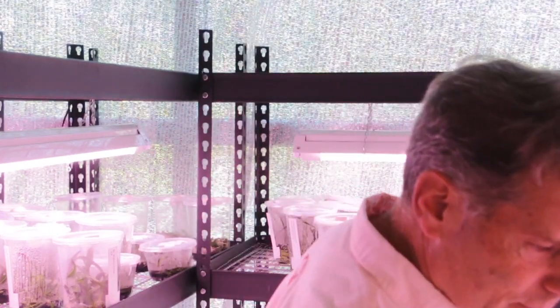So I do a lot of hybridizations. I make a lot of seed capsules, and then I plate the seed capsules. What I want to talk with you about today is how long it takes to recover the seeds, and then sometimes those seeds may not be very useful, or there may be very low embryo counts in the seeds, or the seeds themselves won't have any embryos in them. So there's a variety of things that I want to show you. I want to start out by showing you some of the successes.